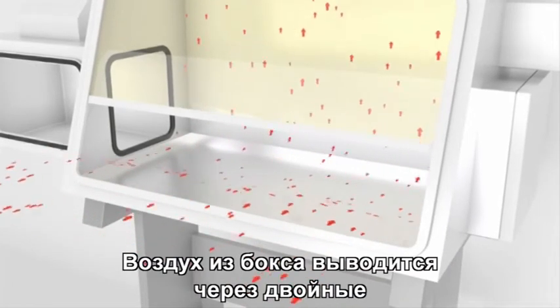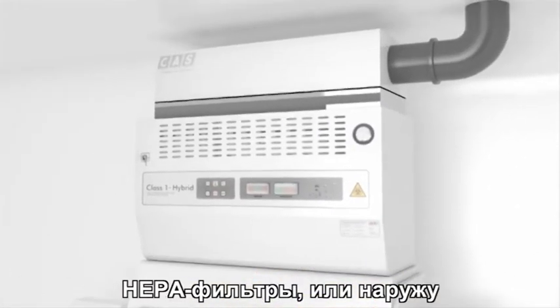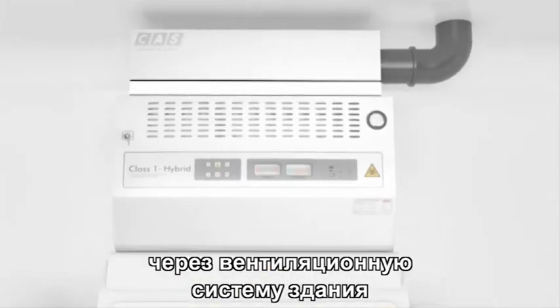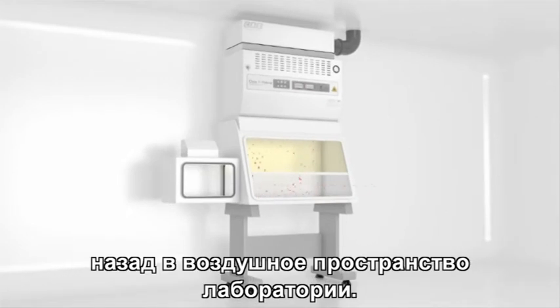The air from the cabinet is exhausted through double high-efficiency particulate air filters, HEPA filters, either to the outside of the building through the building exhaust system or, in the case of a recirculating type, back into the laboratory airspace.